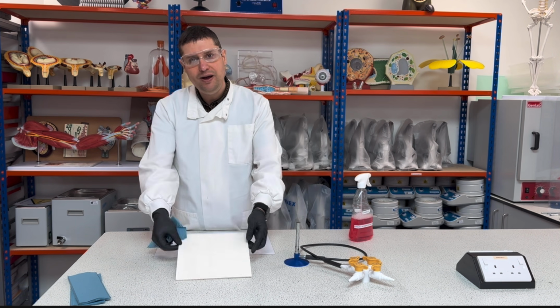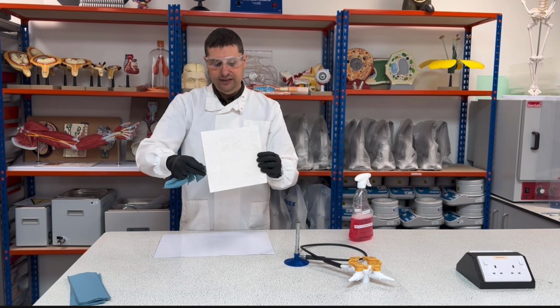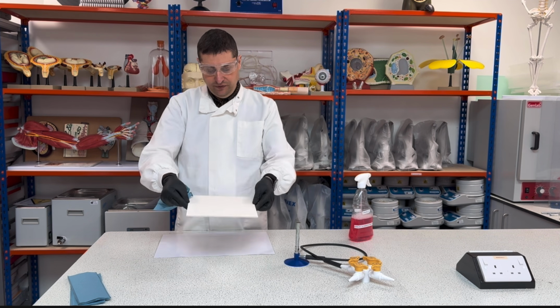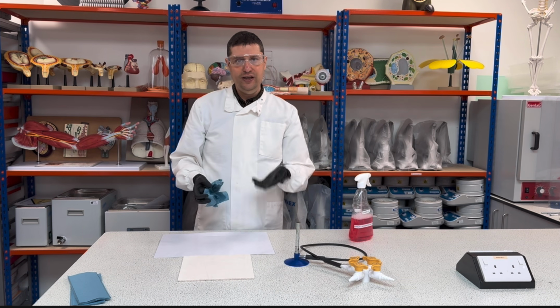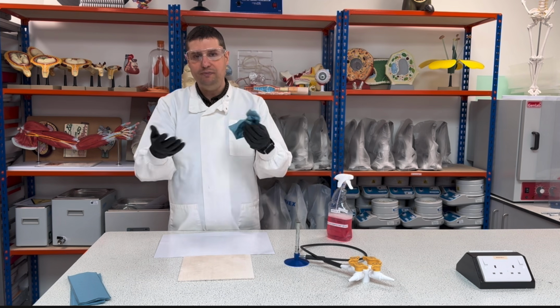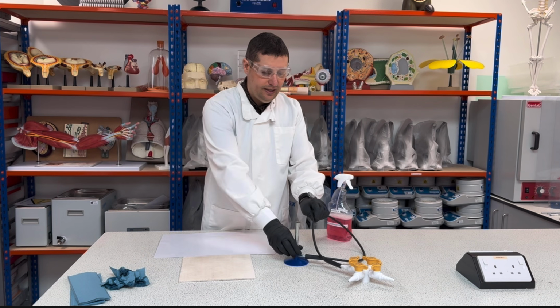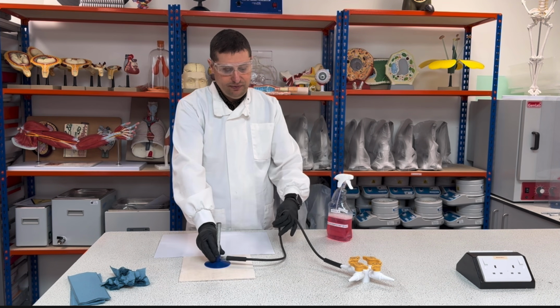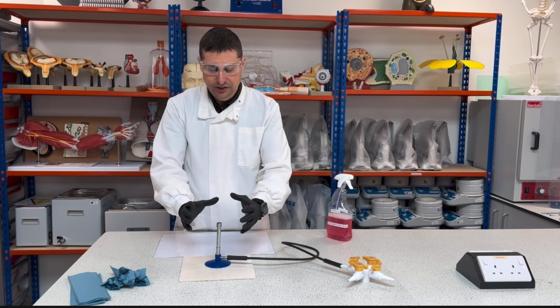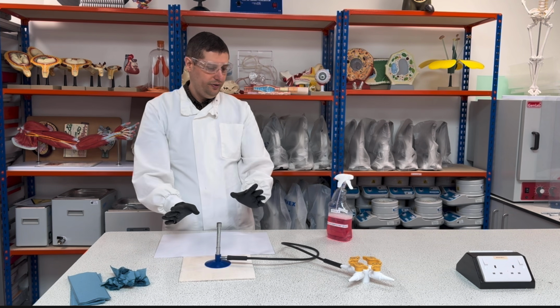heat-proof mat. The heat-proof mat has two areas. One is completely smooth, the other one is a hard surface. The hard surface will be facing down, and the smooth area will be facing up. I will spray again. Leave it to set for about 1 minute, and I will dry this out. My Bunsen burner doesn't need to be disinfected because the Bunsen burner will be sterile in terms of the flame. So the Bunsen burner doesn't need anything.